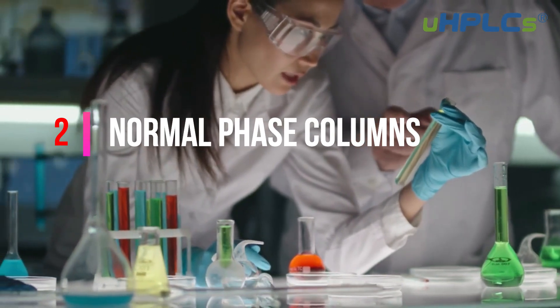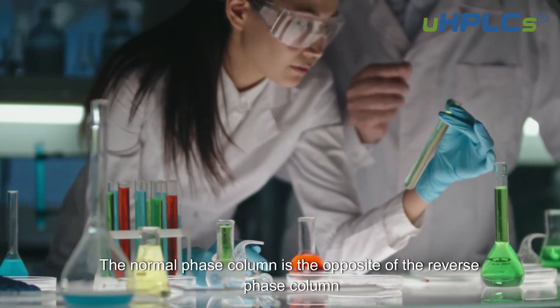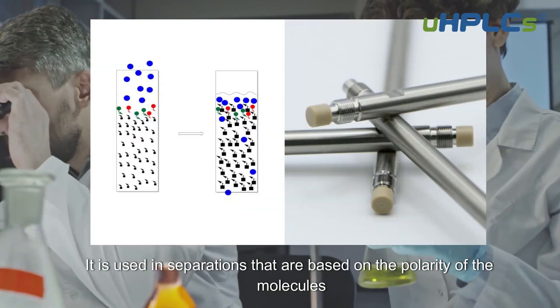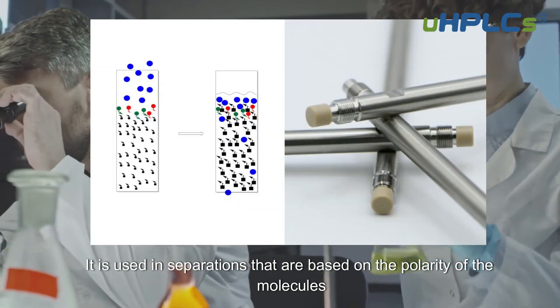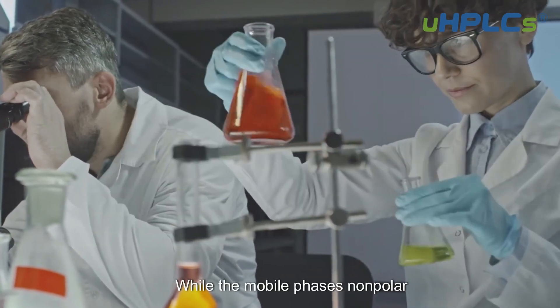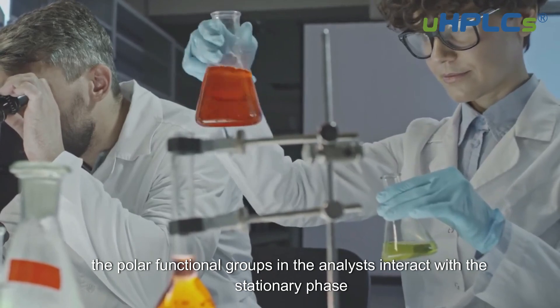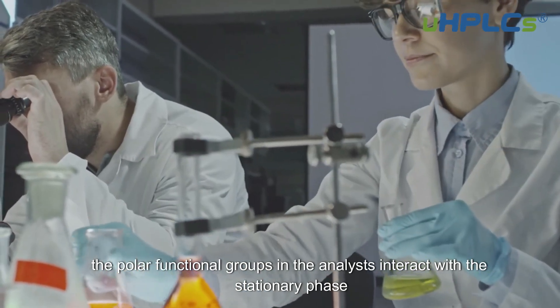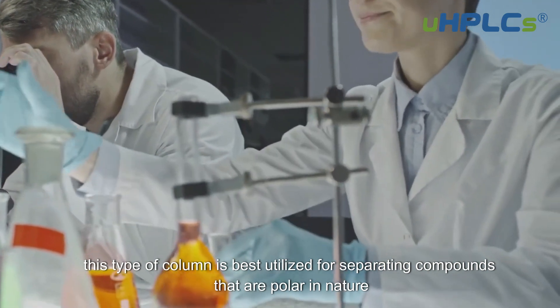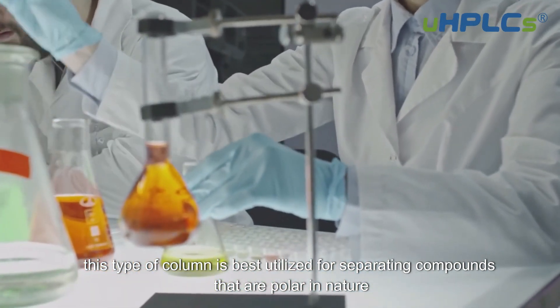Normal Phase Columns. The normal phase column is the opposite of the reverse phase column. It is used in separations that are based on the polarity of the molecules. The stationary phase is polar, while the mobile phase is nonpolar. The polar functional groups in the analytes interact with the stationary phase. This type of column is best utilized for separating compounds that are polar in nature.